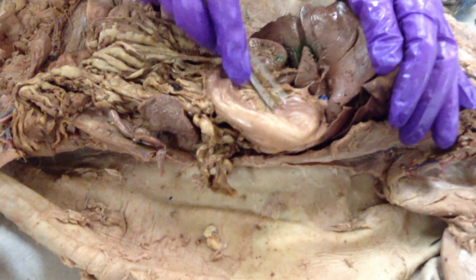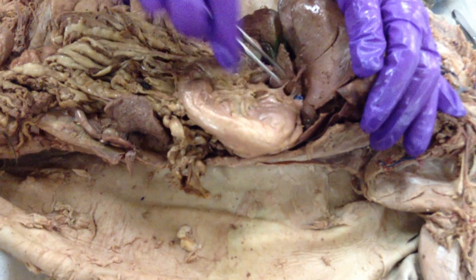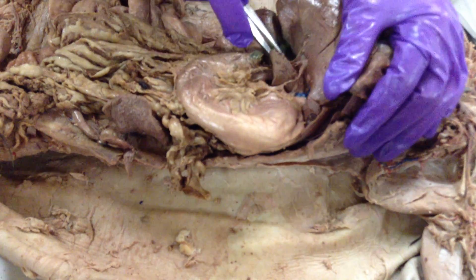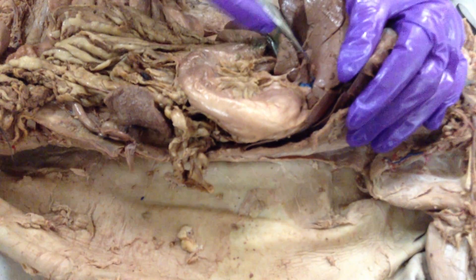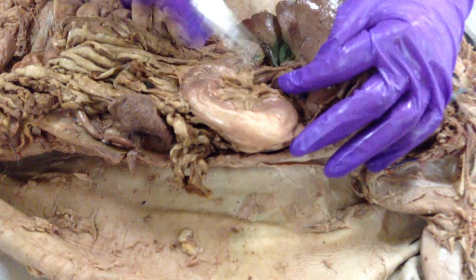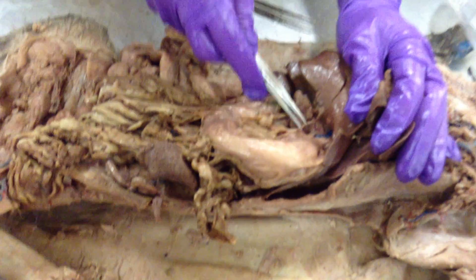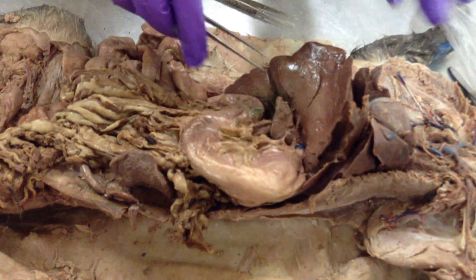Right above your stomach there's this lesser omentum, which is a mesentery that leads from the top of your stomach and intestine area up to your liver. There's not much left of it on this cat, but you can see this clear stuff running through it — a little bit of clear ligament-like stuff. This is the best part of it that's left, and it's called the lesser omentum.